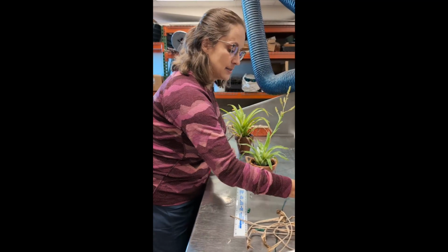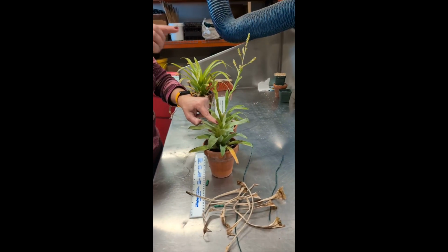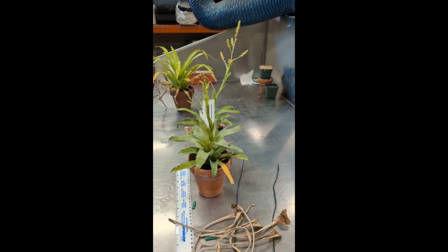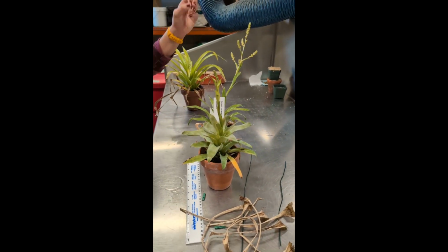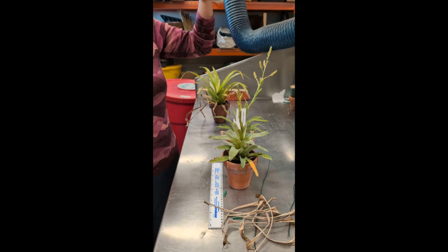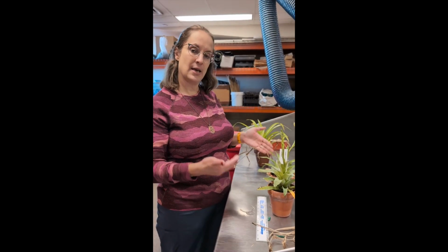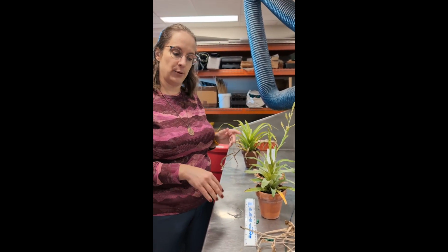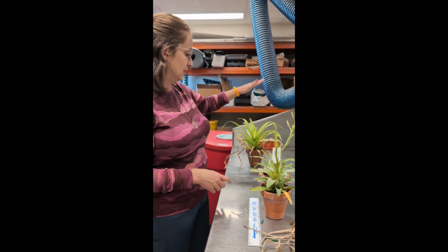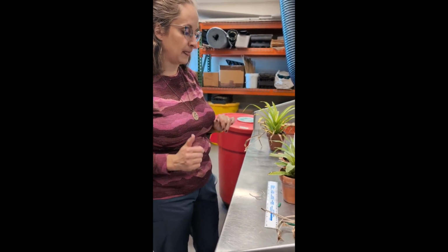In contrast, right, both of these individuals, the shoot apical meristem has now produced an inflorescence. I may want to talk about categories about, are the flowers open? Are there fruits? These are young inflorescences with no open flowers. Maybe that's like a category 1. So I could maybe have a column on shoot apical meristem, 0, 1, 1 on these different individuals.